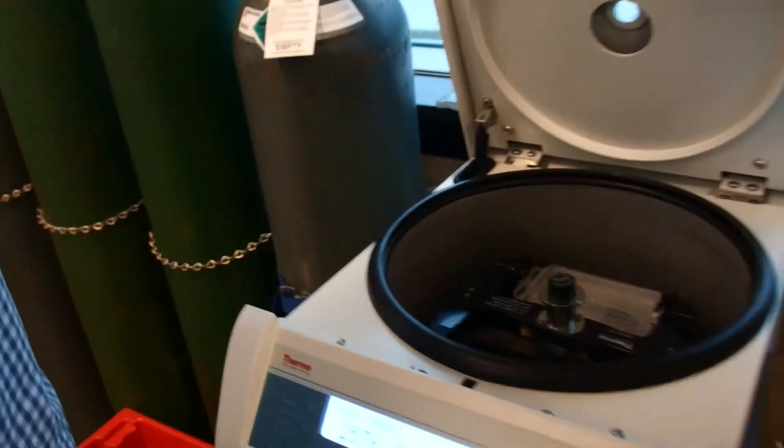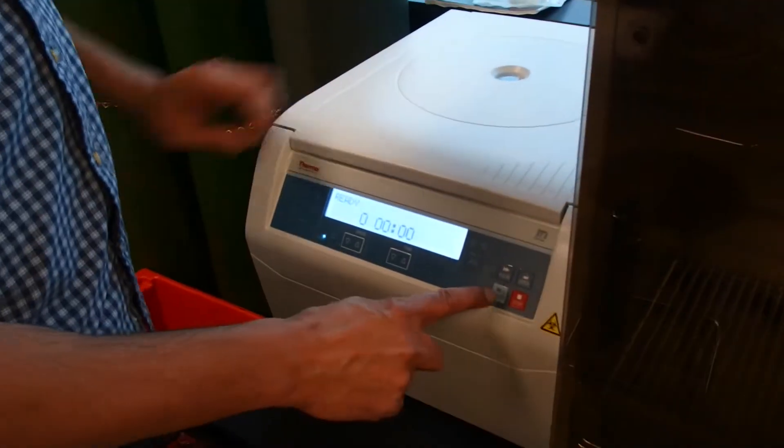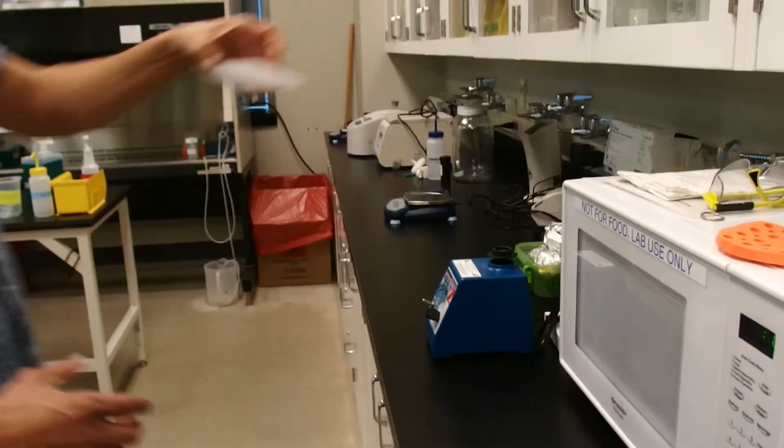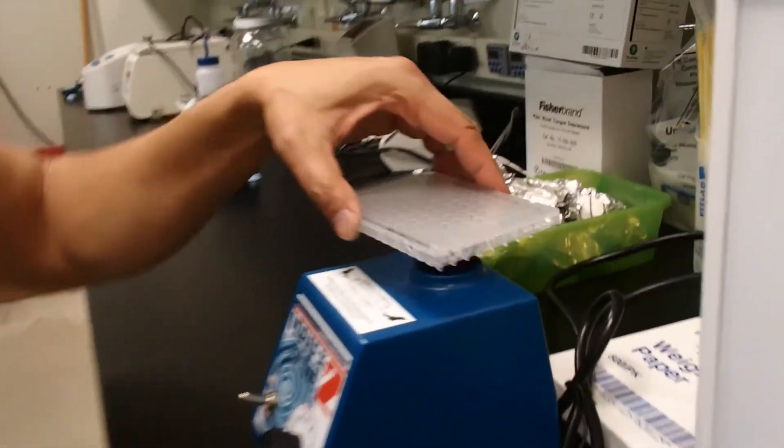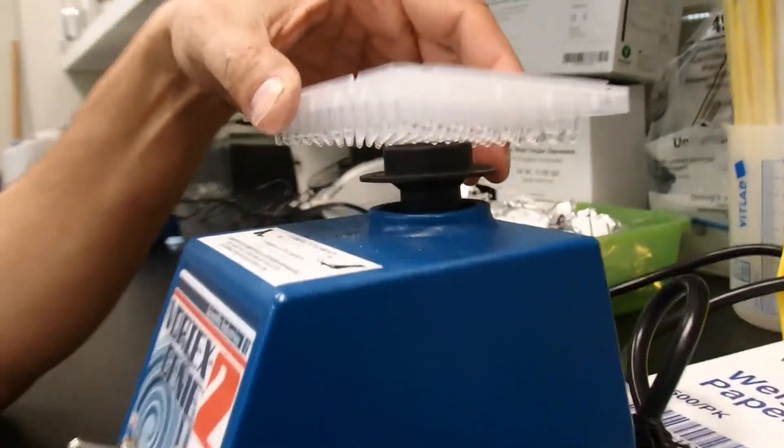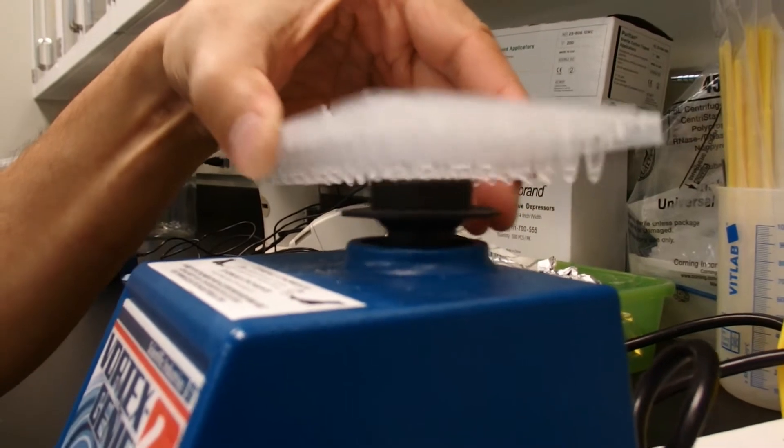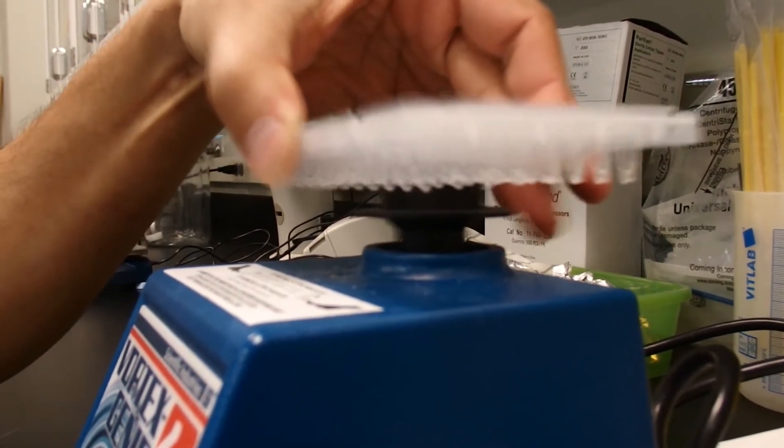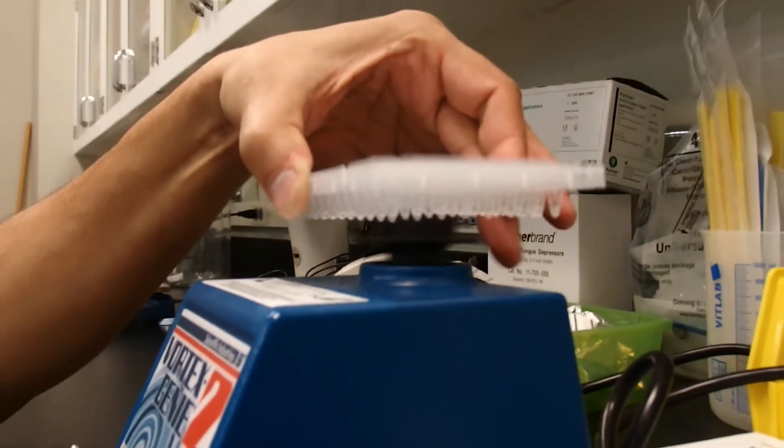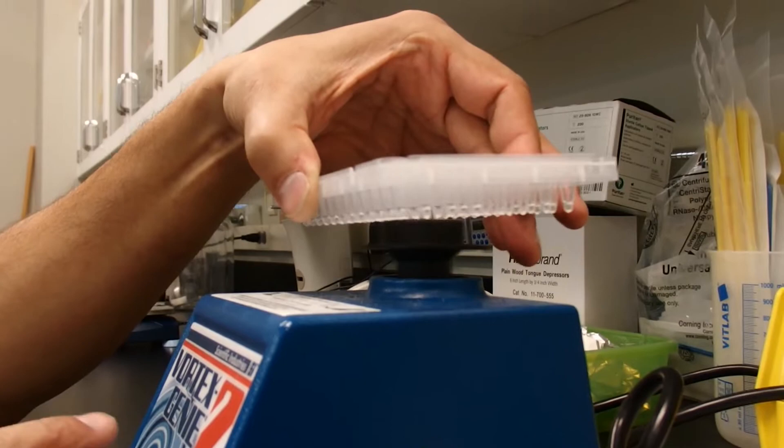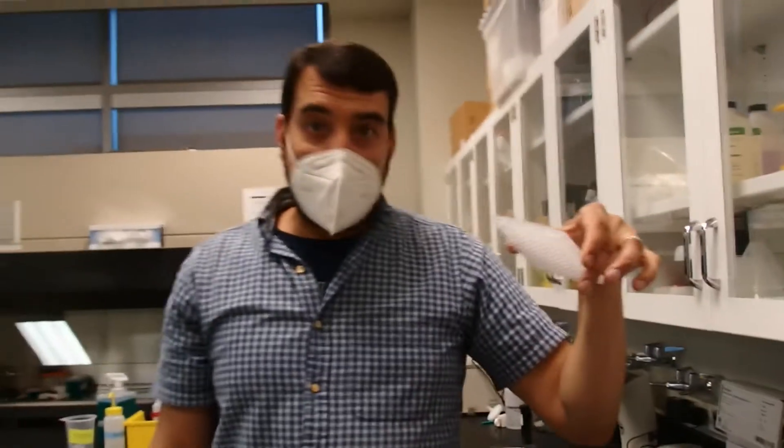We need to balance the centrifuge. Everything is collected on the bottom and now we just need to mix it well. If the template and the mix are not mixed well, you'll have PCR that doesn't work very well. You want to mix until you see swirling happen. When your wells swirl you're good, you don't want foam but you want some swirling. So that's what I got there.